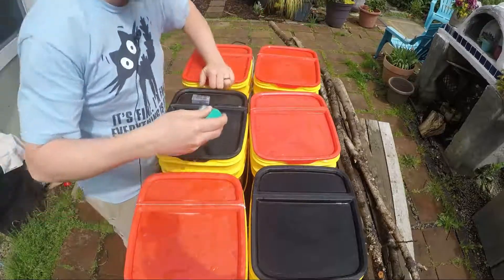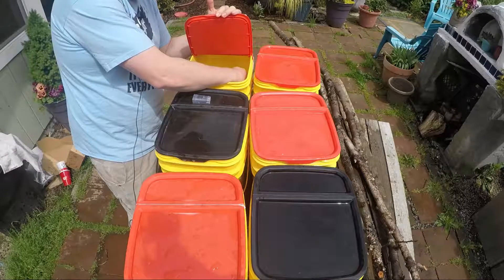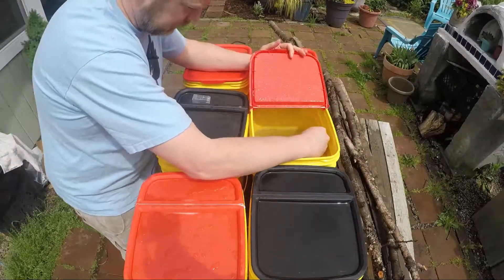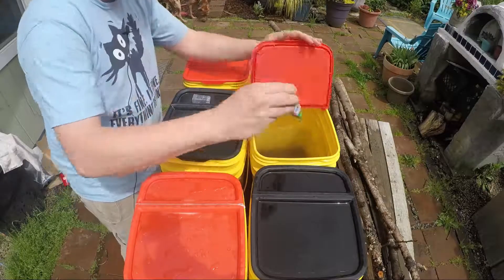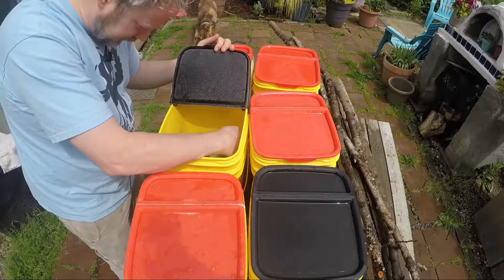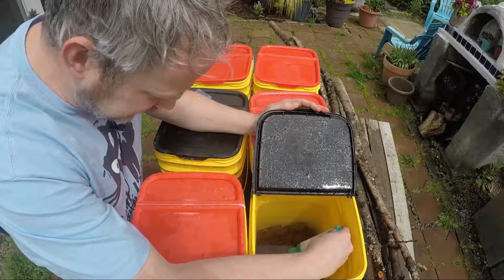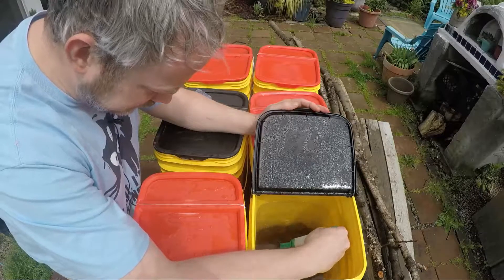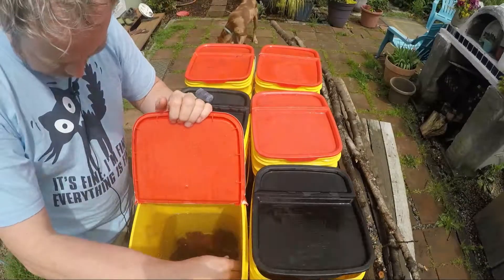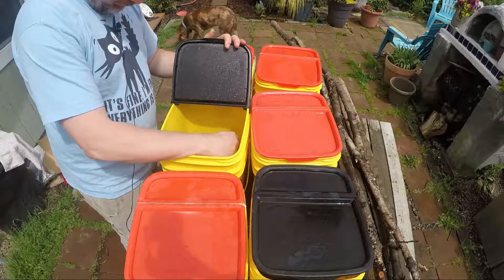We have seven four on rainwater, going back and forth to verify. Rainwater is holding at seven four, seven three. Commercial lava rock was seven eight. Commercial lava rock in rainwater — seven nine, seven eight to seven nine. Bulk lava rock — interestingly, the water is actually clearer. Seven seven, six seven, seven seven, seven seven. Bulk with tap. Rainwater bulk lava rock: seven five. No adjustment with the bulk lava rock — seven point four in the rainwater.